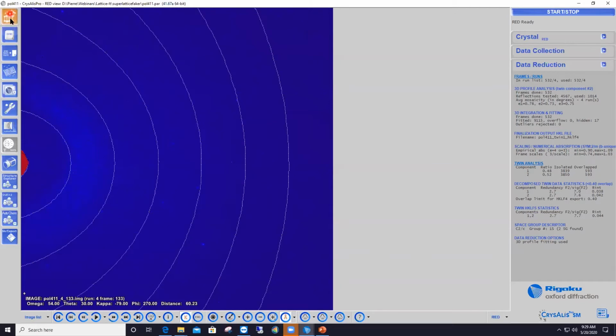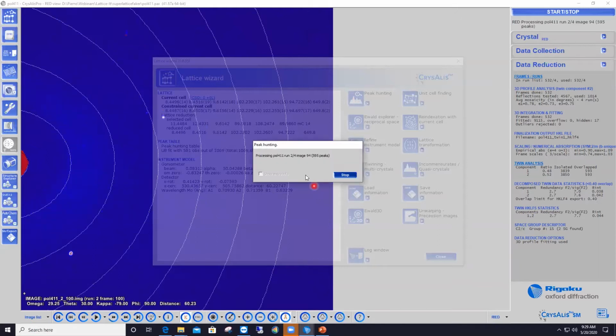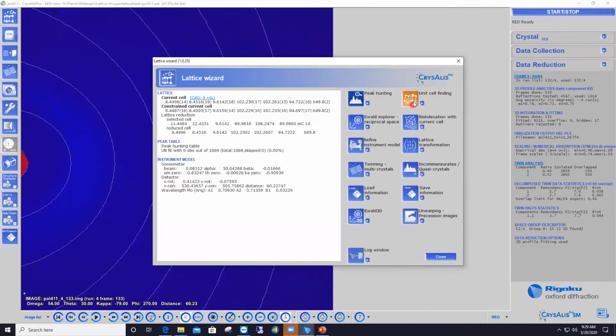So let me go to the lattice wizard, and then I run a peak hunting with the defaults, gathering reflections on all 4 scans of the dataset, and then I do an indexing by pushing the button unit cell finding. And I've got 82% of my reflections indexed, which is a really good number. So at first glance, many people would tell you that your indexing just worked fine. Except if you look at the unit cell parameters, something is weird, because I've got a long unit cell edge of 67 angstroms, which is more like a unit cell edge for a protein structure and not for a small molecule.